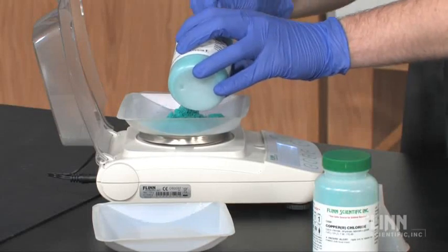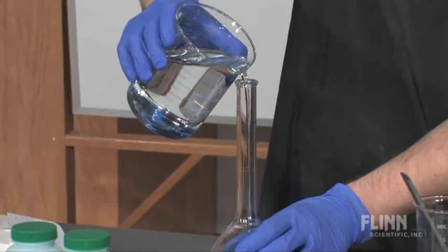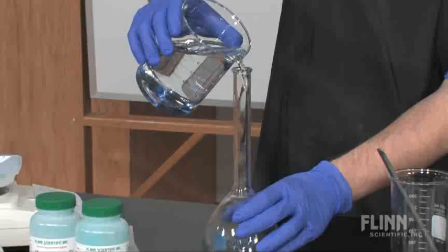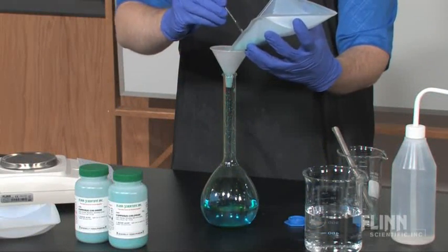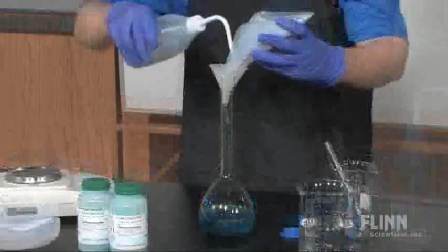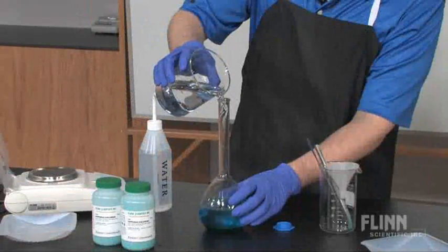Using a balance, obtain the required amount of solid. A volumetric flask gives the most accurate volume measurement. Add in some of the water, add in the solid, stir and mix. Keep adding water and stirring until the correct volume of solution is reached.